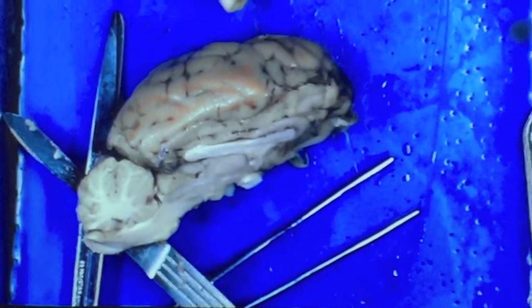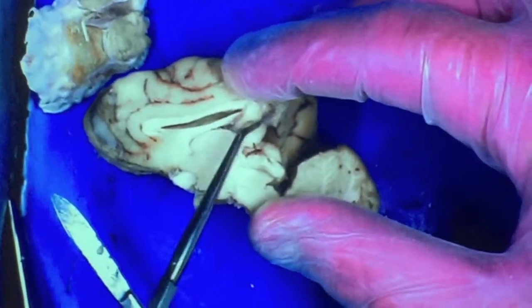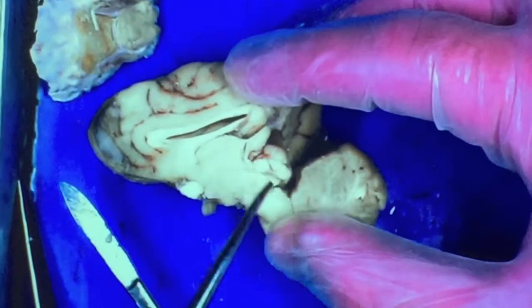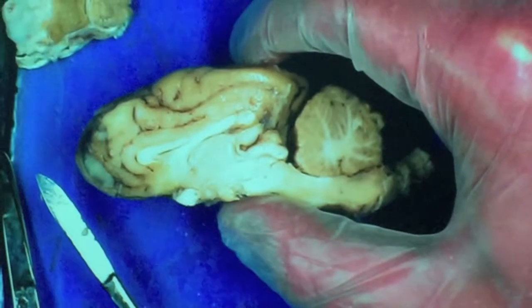The next couple of items we saw before on the intact brain, but we'll see them again here. Your pineal body, or pineal gland, you'll be able to see has been cut in half. And then your corpora quadrigemina with the superior and inferior colliculus has been cut open. You can see the same structure that you saw before. One way to sort of check yourself sometimes, put the two halves together and make sure that what you're identifying is the same thing you saw in the intact brain. That's a useful way to test yourself and make sure that your identifications are correct.